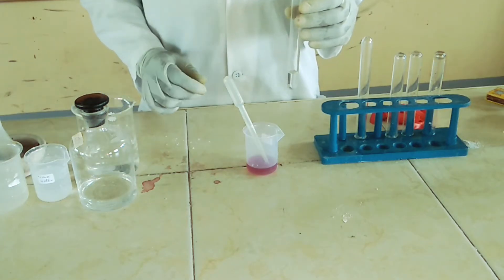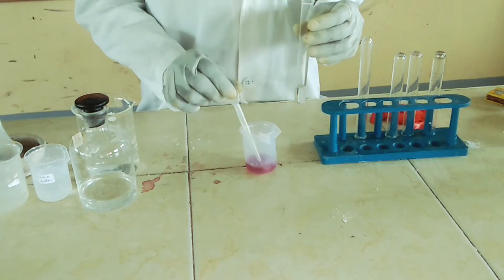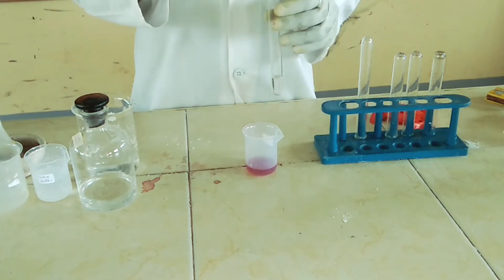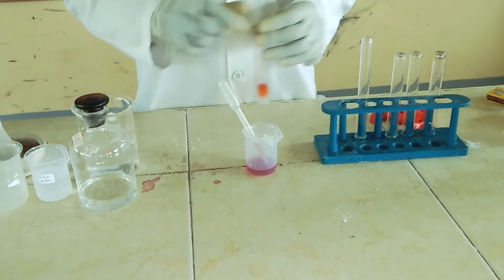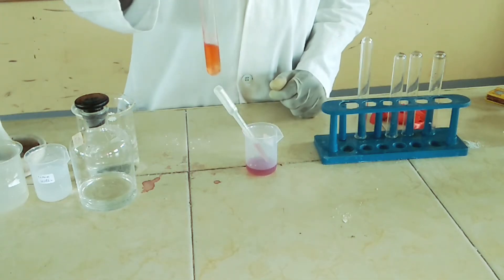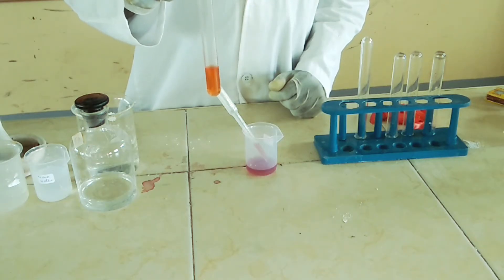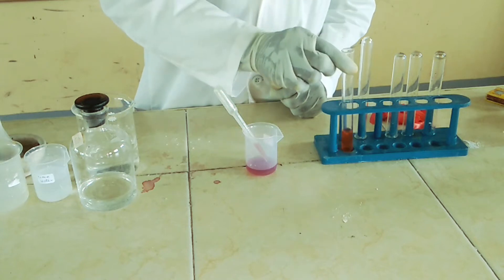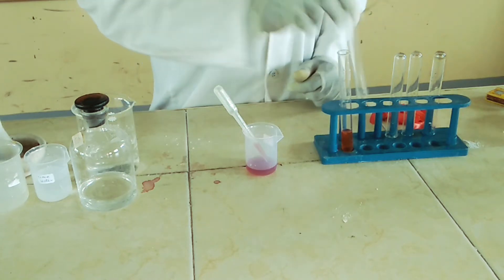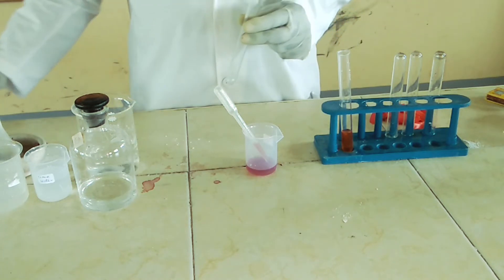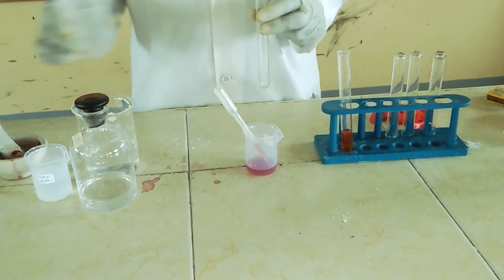Put some small amount of hydrochloric acid, let's say around 10 centimeters cubed, in a test tube. Then I'm going to put two drops of the indicator and shake. So we get an orange color that is almost red. That's the color in an acid.